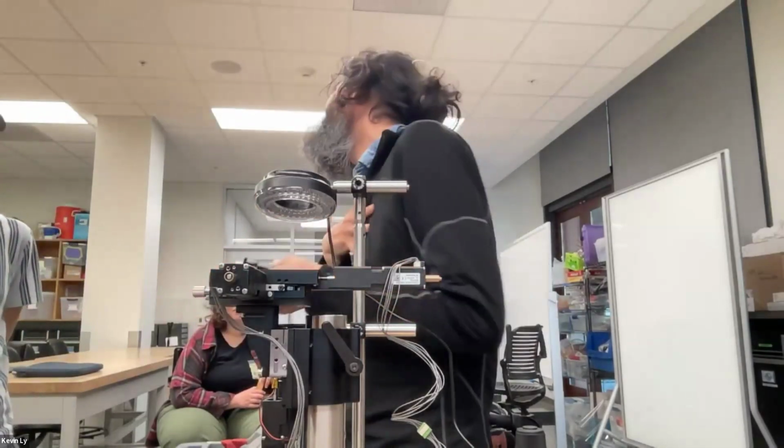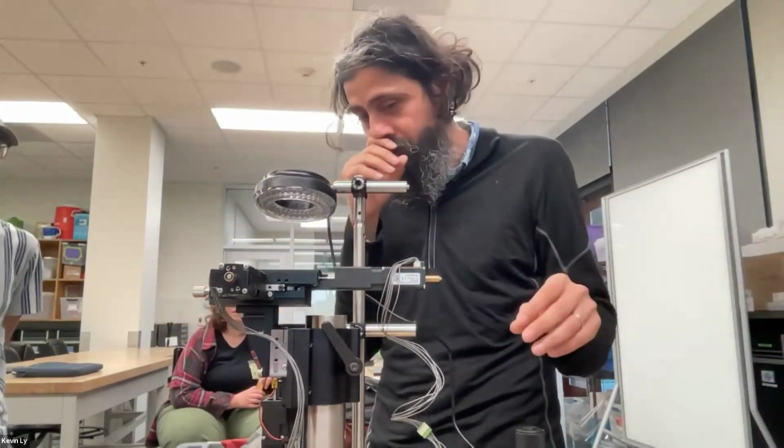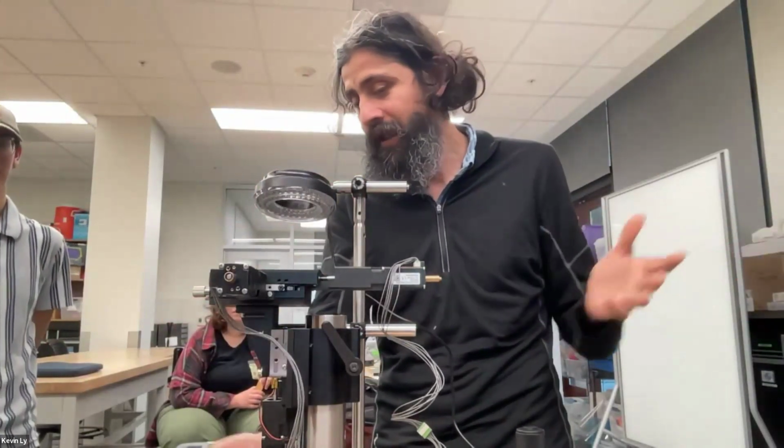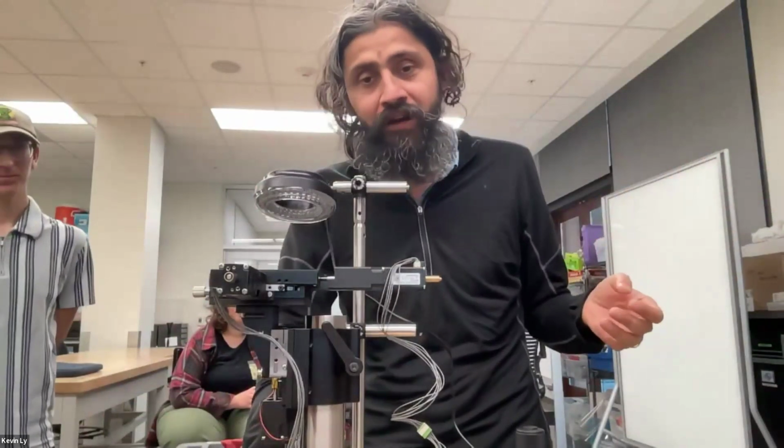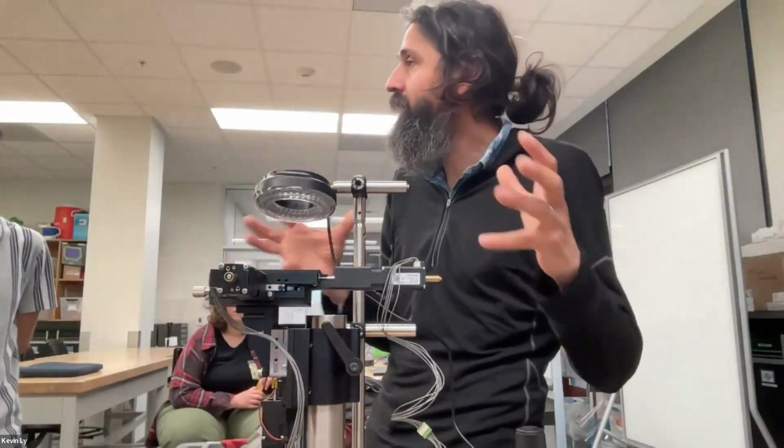We use a ton of Thorlabs parts. We love Thorlabs. Okay, I have to run, so I'm just going to say the last set of components. These posts, you can see they're Thorlabs. You can machine them, breadboards and sets of components. You can see those. So now you're starting to say, oh, I have a microscope, right?